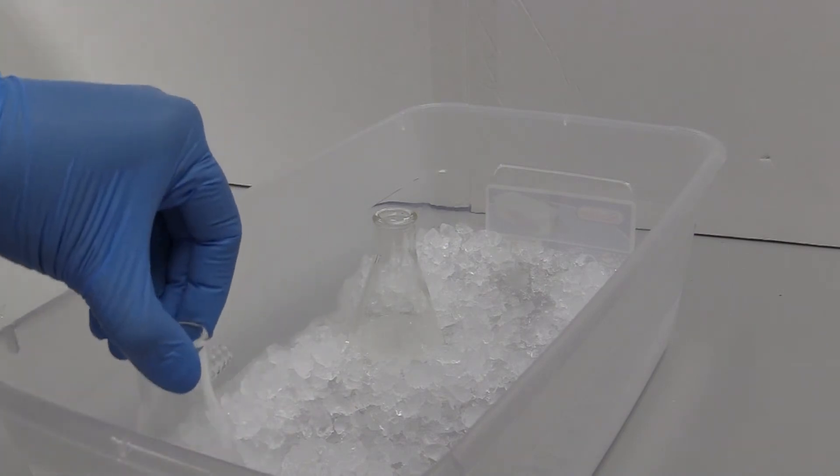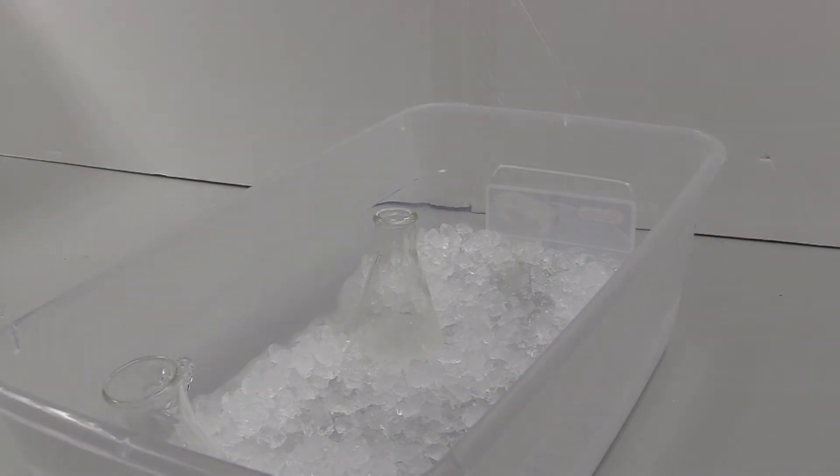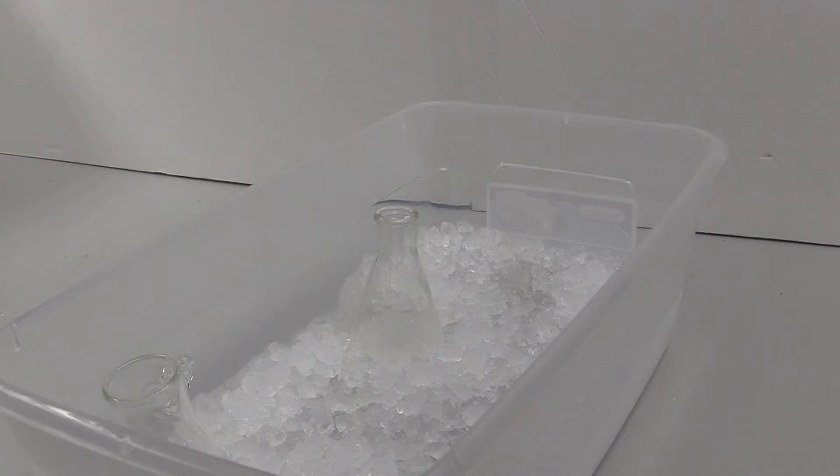If you go right from the heat to the ice bath, you will have tiny crystals that will be hard to collect. So make sure you cool it to room temperature before putting it in the ice bath.